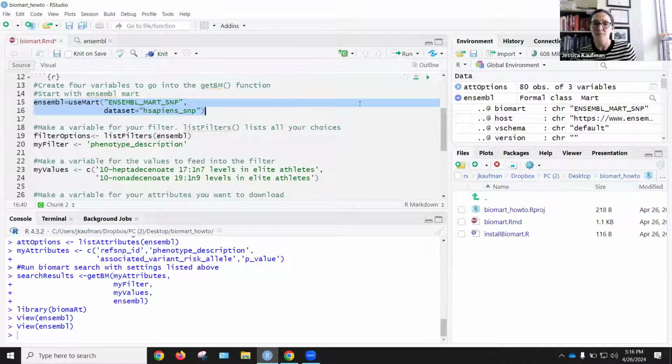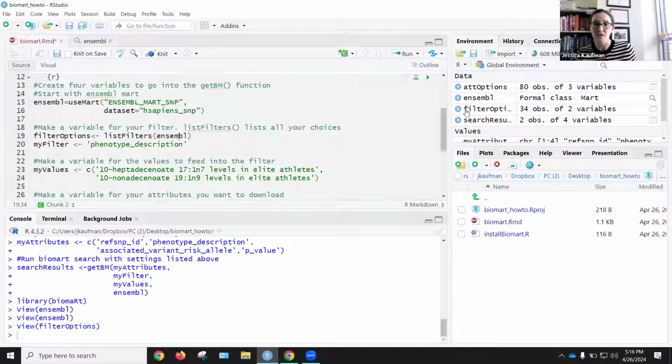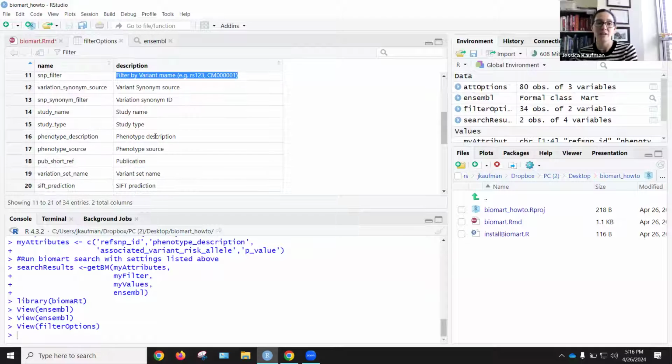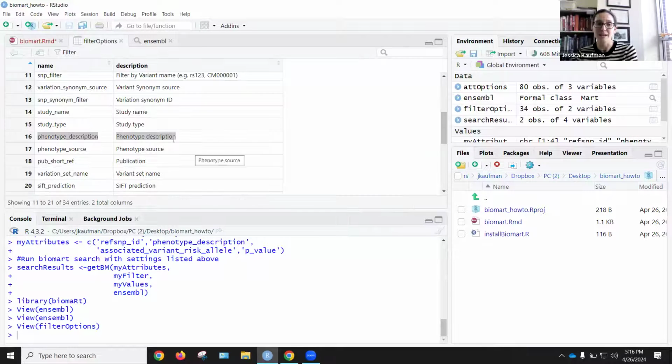For the filter, we can look at each of the filter options by having a variable that lists the filters. If I double click on this, I'll see in a data frame all the choices that would be on the pull down menu if I was on the website. I can see chromosome name, marker, study name, phenotype description, SNP filter. This is what we used for the first assignment this week, and then phenotype description is what we're using for the second half of the assignments. So I'm setting my filter to phenotype description. The best practice is to copy it directly from here to make sure that you get the capitalization and the underscore in the right place.